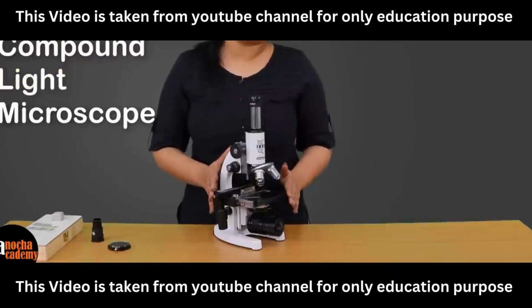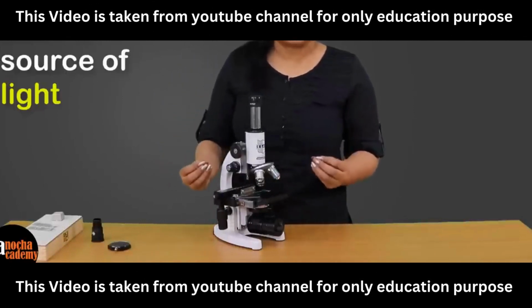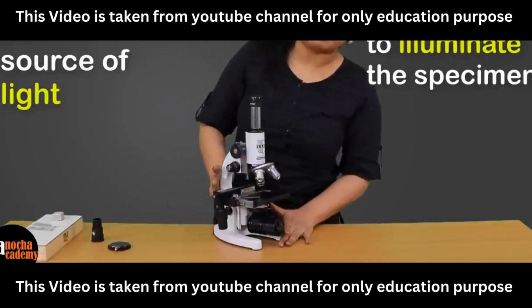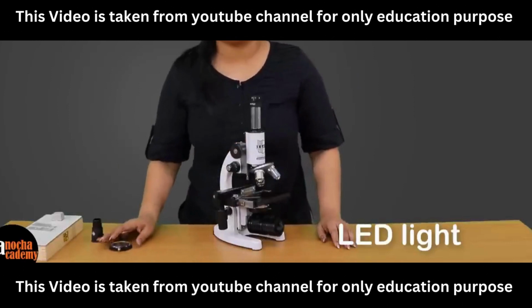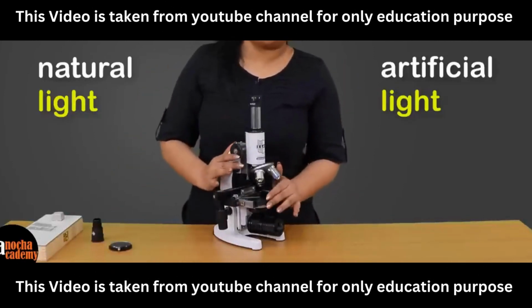Why is it called a light microscope? It is called a light microscope because we use a source of light to illuminate the specimen that we are trying to see. So in this microscope, we will use LED light. However, you can also use natural or artificial light to light up or illuminate the specimen.